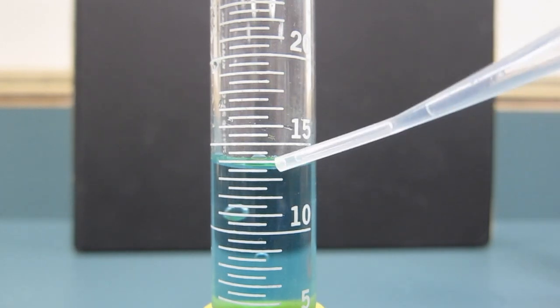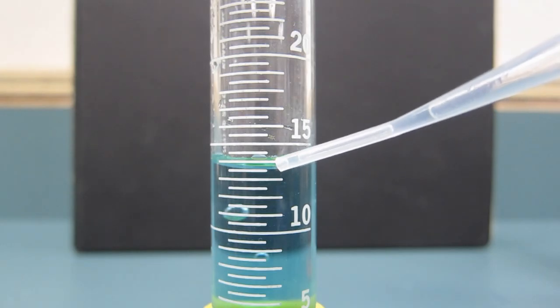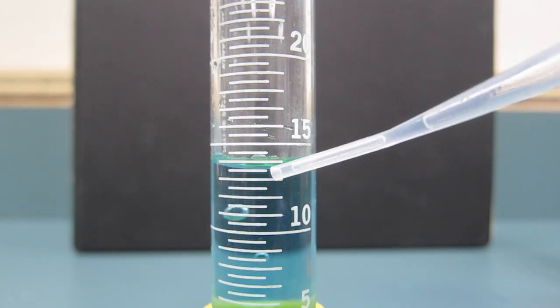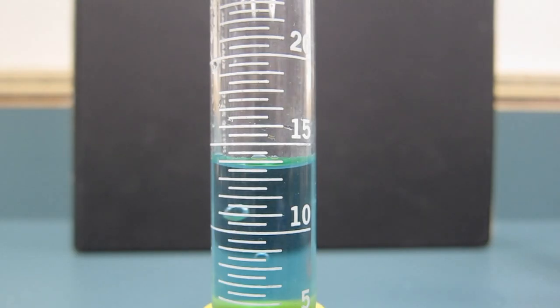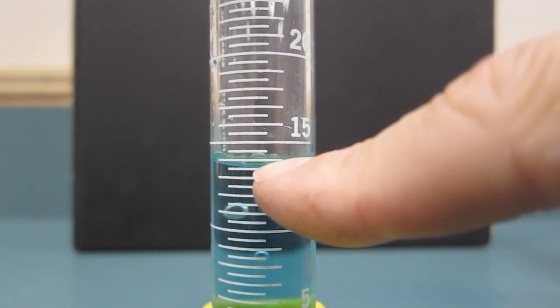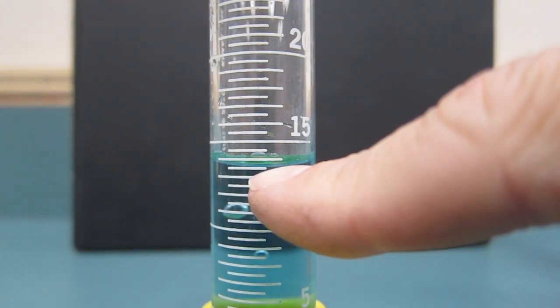I actually right now have not quite 14. I have, it looks like about 13.5. You can see that actually, the bottom of the meniscus is right here. That's where I'm reading from.